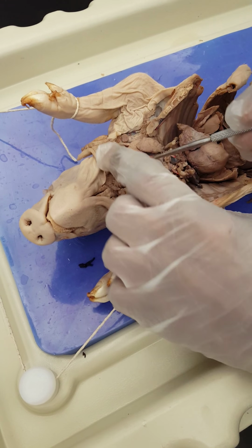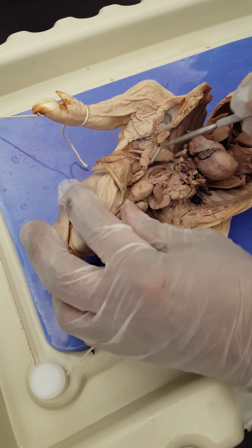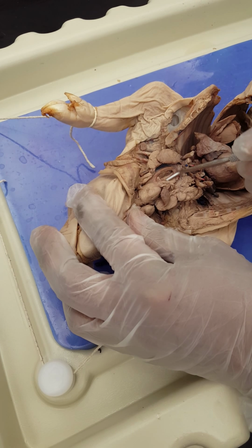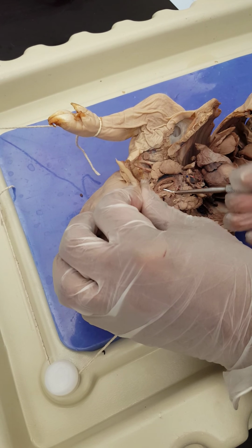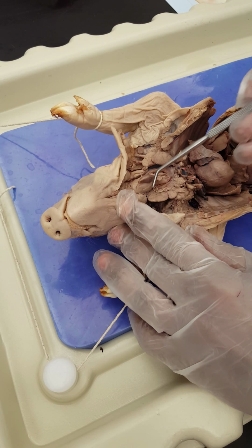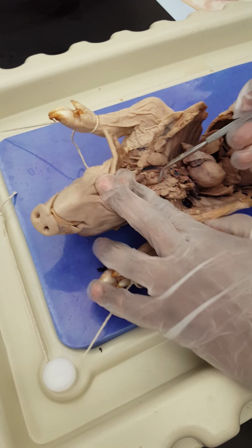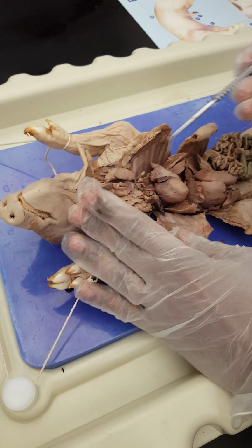Okay. If you push the trachea a little bit on the side, and you went behind, you're gonna see the esophagus, which is a muscular tube. This is the esophagus here, okay? Let me just take it out like that. Esophagus, okay? So larynx, thyroid, thymus, trachea, esophagus. Okay? You go down, look at the heart.